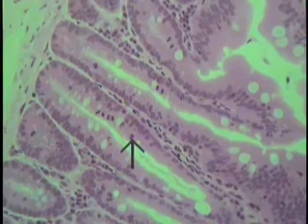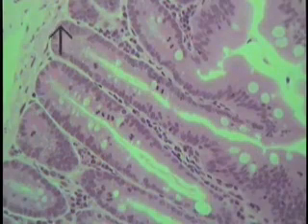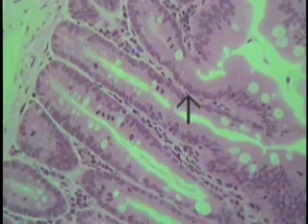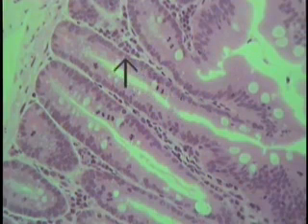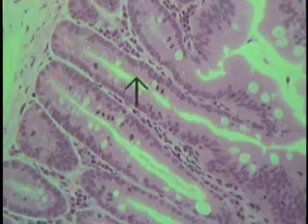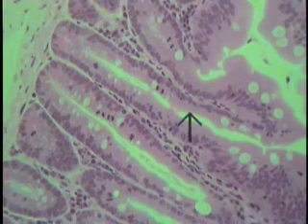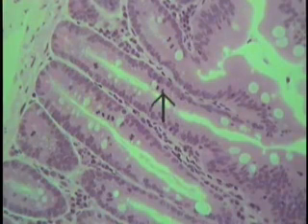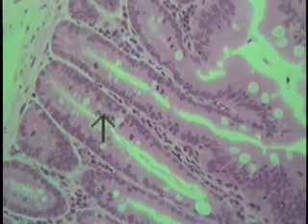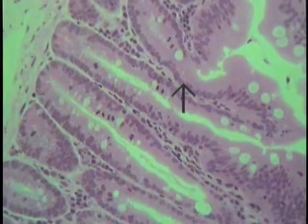At increased magnification, a simple tubular gland is indicated by the pointer. Note it is made up of a cellular wall. The nuclear profile is indicated here by the tip of the pointer, and the cytoplasmic extent of these cells is also shown. Even at this intermediate magnification, numerous dark, intense-staining objects can be made out. These are the chromosomes of several mitotic figures.